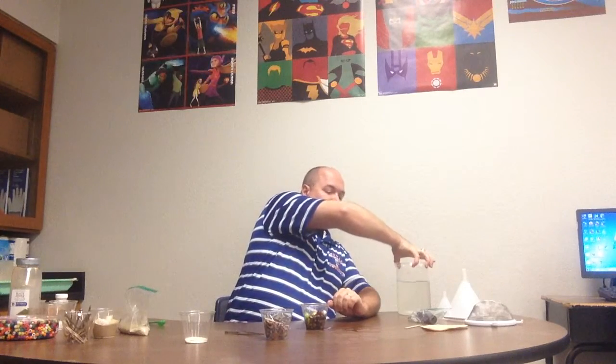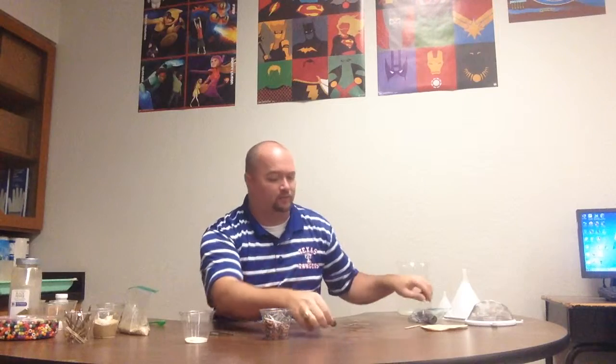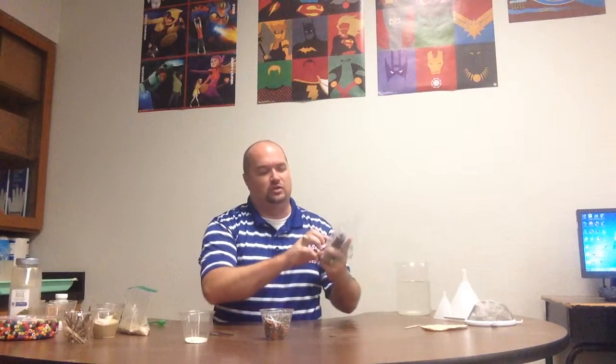Well, what property is it? How about magnetism? But Mr. Beckwith, they're both made out of metal. Aren't all metals magnetic? No, not all metals are magnetic. There's actually only 3. And if you've been in my class this 6 weeks, you should know what the 3 magnetic metals are. The first one is iron. The second one is nickel. And the third one is cobalt. Which means copper is not one of those 3. So you're telling me that copper is not magnetic? Well, let's see. Copper penny. Here's my ceramic magnets.